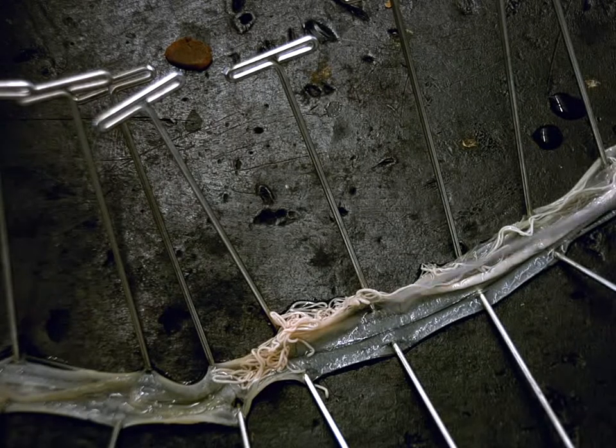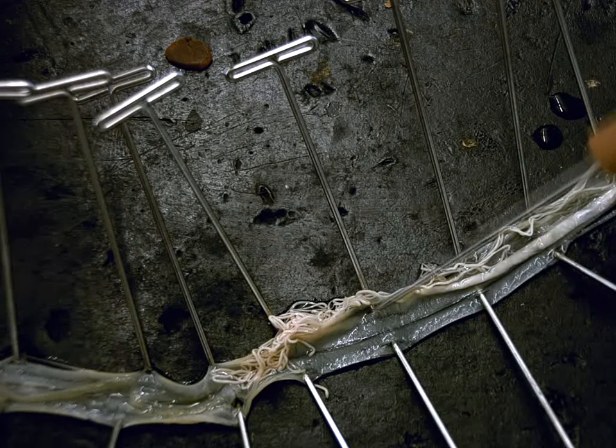The only other thing sitting in the cavity is the reproductive system, which is all these creamy colored tubes.